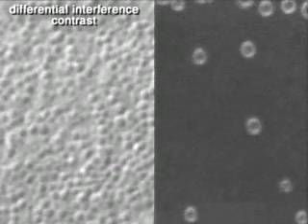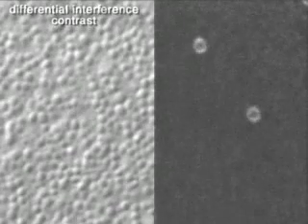On the left, differential interference contrast microscopy is used to directly view the exocytic vesicles that underlie the plasma membrane. The vesicles are visible here because they are densely packed with protein and consequently have a different refractive index from the surrounding material. Each time a vesicle undergoes exocytosis, it disperses its contents and disappears from the image.